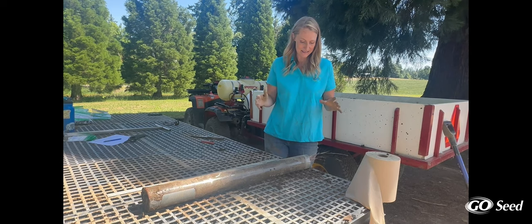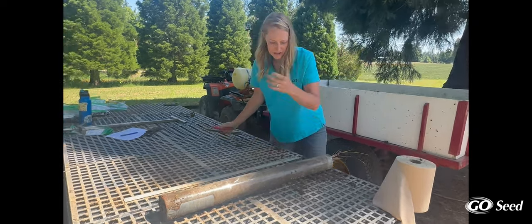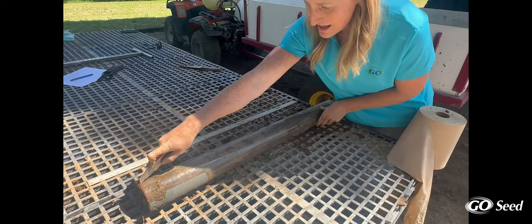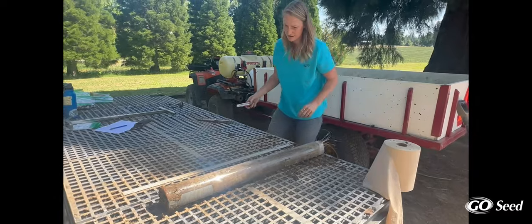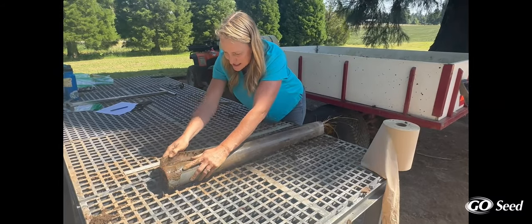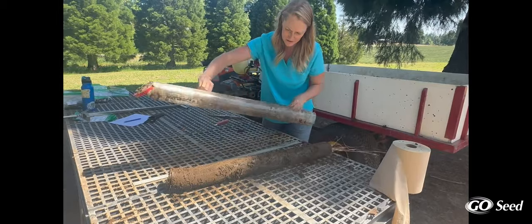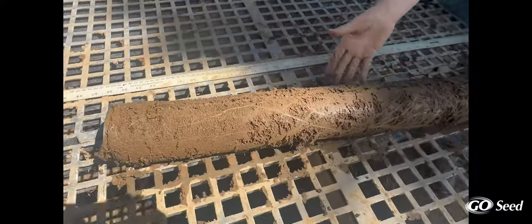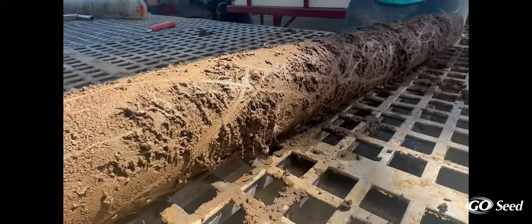What we're doing today is sampling the pH of these soils. I've got these tubes with the layers at set pHs, and I'm just going to cut open this tube. I saturated these last night so that they would be nice and wet. Rolling them out, we can see tons of roots in there all the way through the soil profile. So even with this low pH environment, we know that the roots made it all the way through the soil.